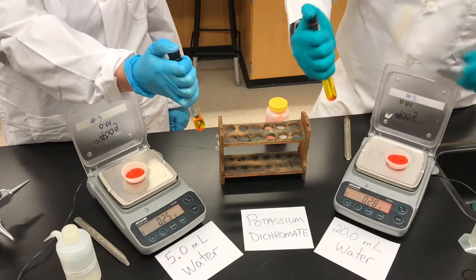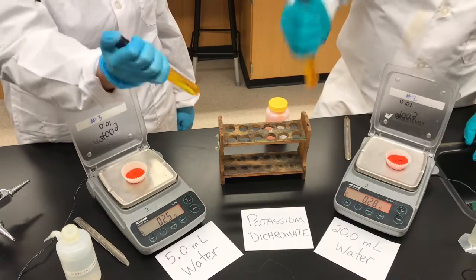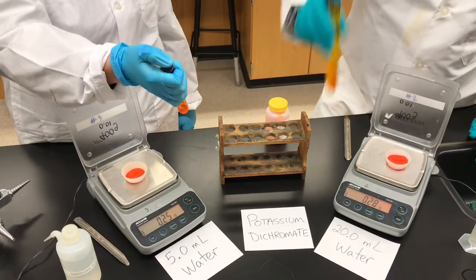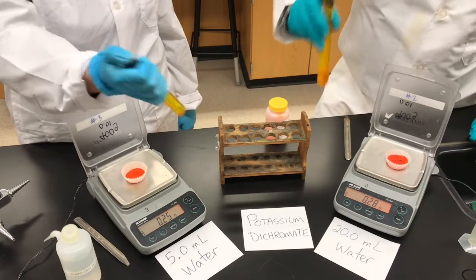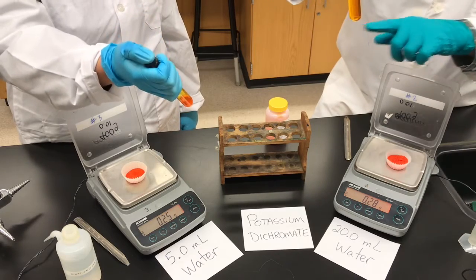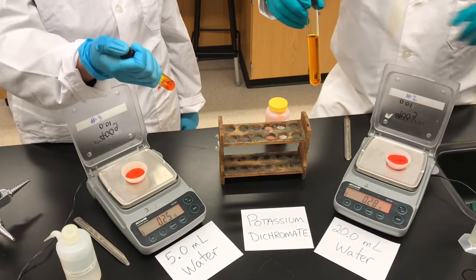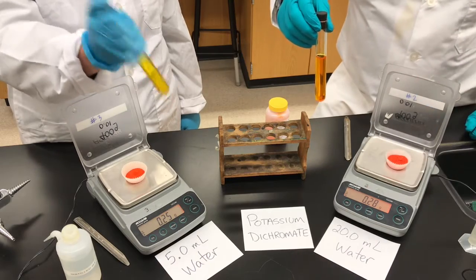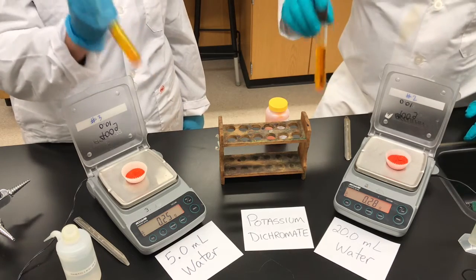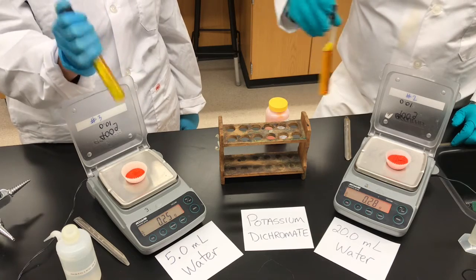We'll make it a solution — we'll put our thumbs on top of the stopper and shake vigorously until that pinch of salt completely dissolves. At a given temperature it may take a bit longer depending how much you've added. We're going to continue adding pinches like this until no more salt dissolves. When we add that last pinch and it doesn't dissolve even after shaking for a long time, we'll have a saturated solution, and we'll see how much salt it took for the 5 milliliters versus the 20 milliliters.